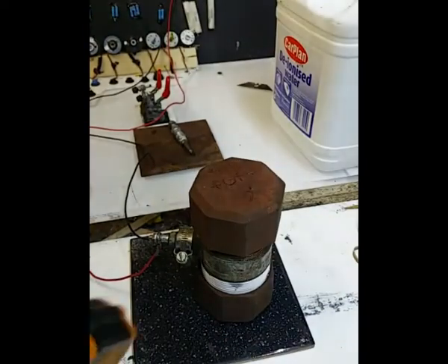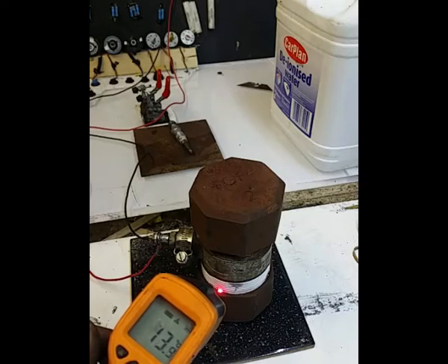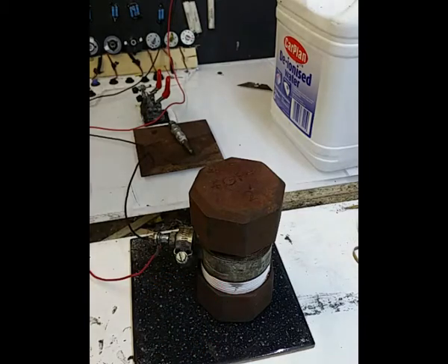Yeah, the base is quite hot as well, so let's have a little look at that. Well, yeah, I mean, 77 degrees now.